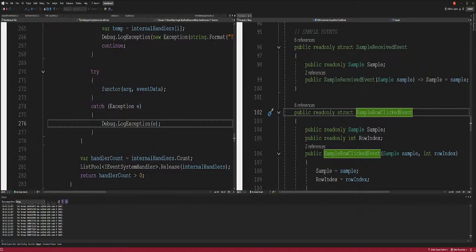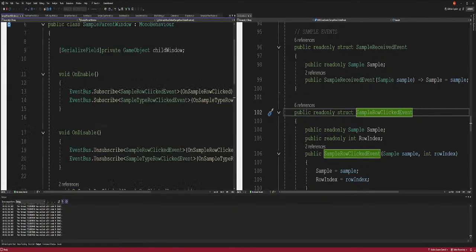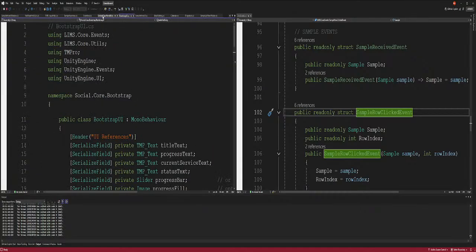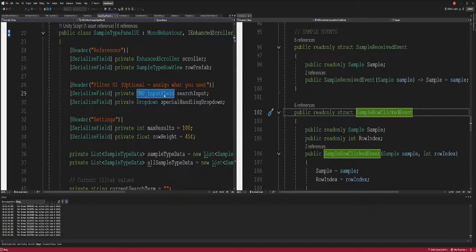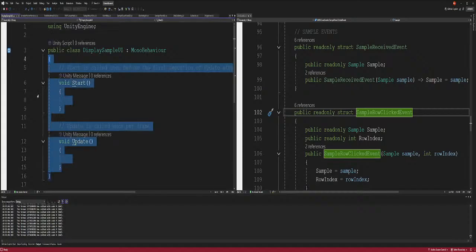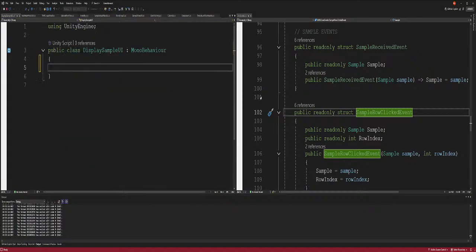Okay, so it's gonna pop up here in a minute. Let's just get this type here, private. What is this type that we use? Oh, right here. I don't want to do the input. Okay, there we go. We just want to display the data. Let's get the type that we're supposed to be using. The problem with this is you're gonna have to reference. But right now we know what we need to do, right?